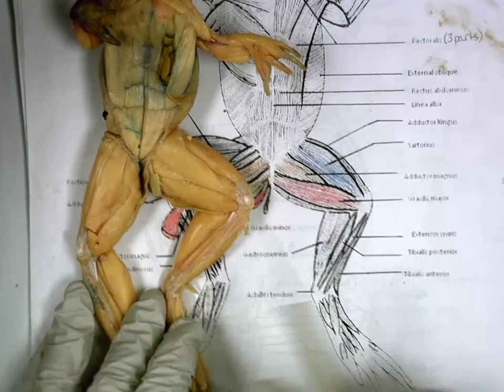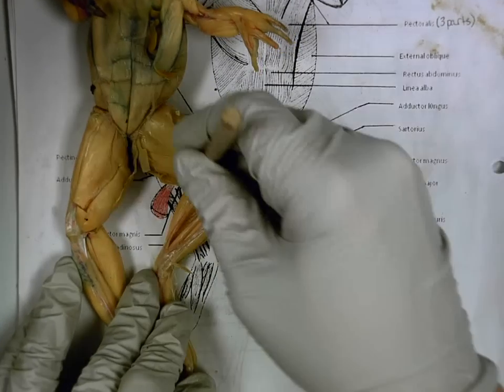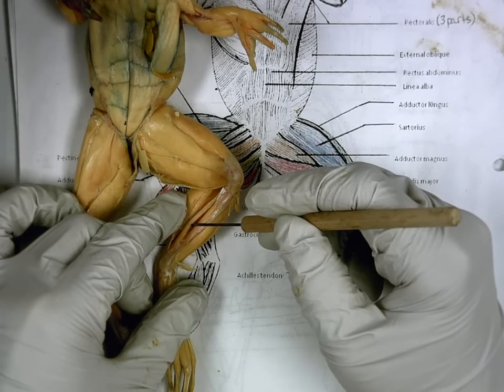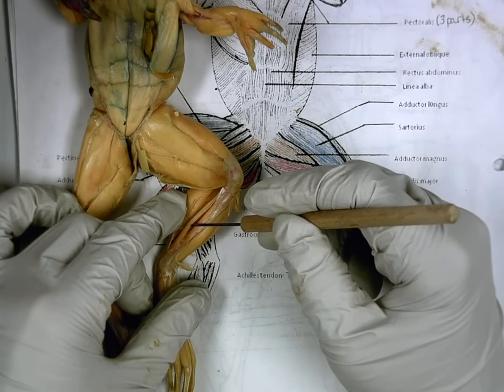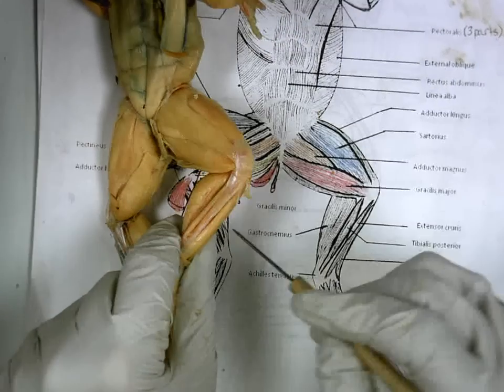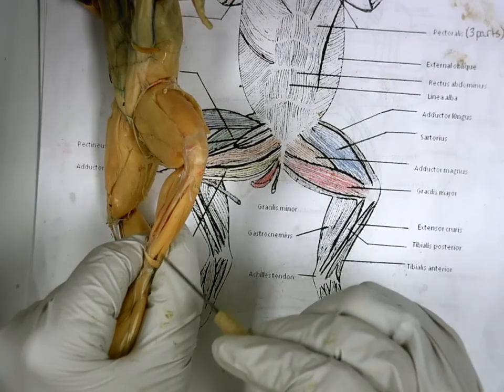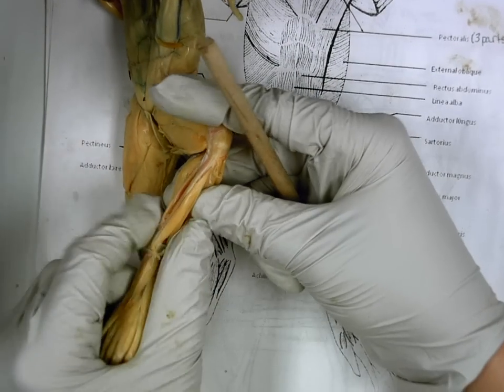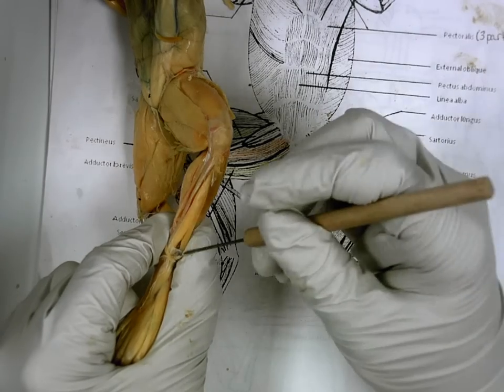Then we go down to the bottom, to the calf. Calf is still, big one. Gastrocnemius. Behind the bone, tibialis posterior. Then we have, if I kind of pull my finger here and I rotate, in the front is a capital A. It comes to a sharp. Tibialis anterior, like a capital A.